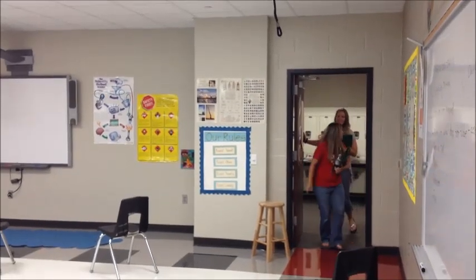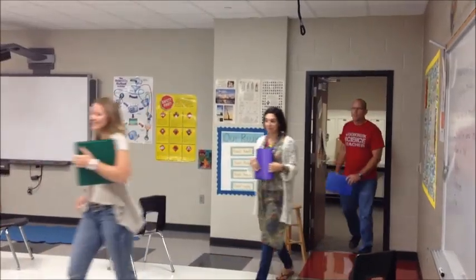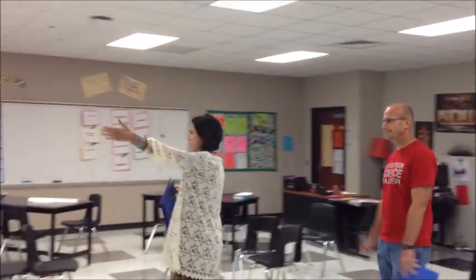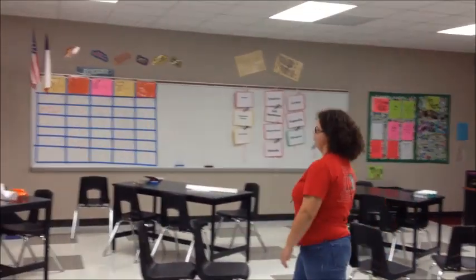Good morning, kids. Okay, y'all make sure you come in and have a seat. We're totally going to do a lab today, but you know your rules. Don't start using the equipment until I've told you to. Wow. All right. Becky, join your group.